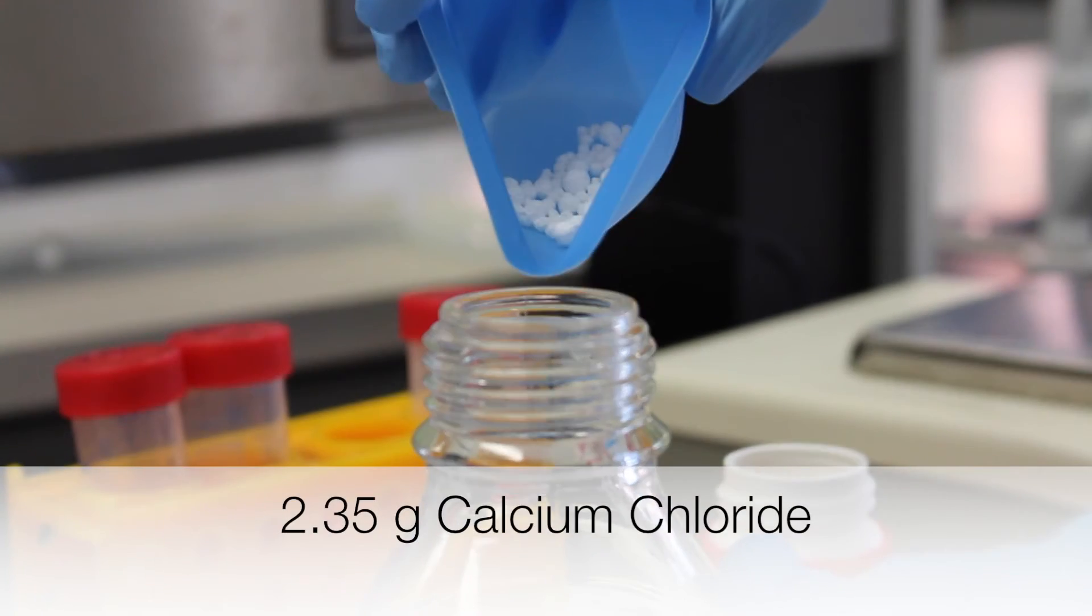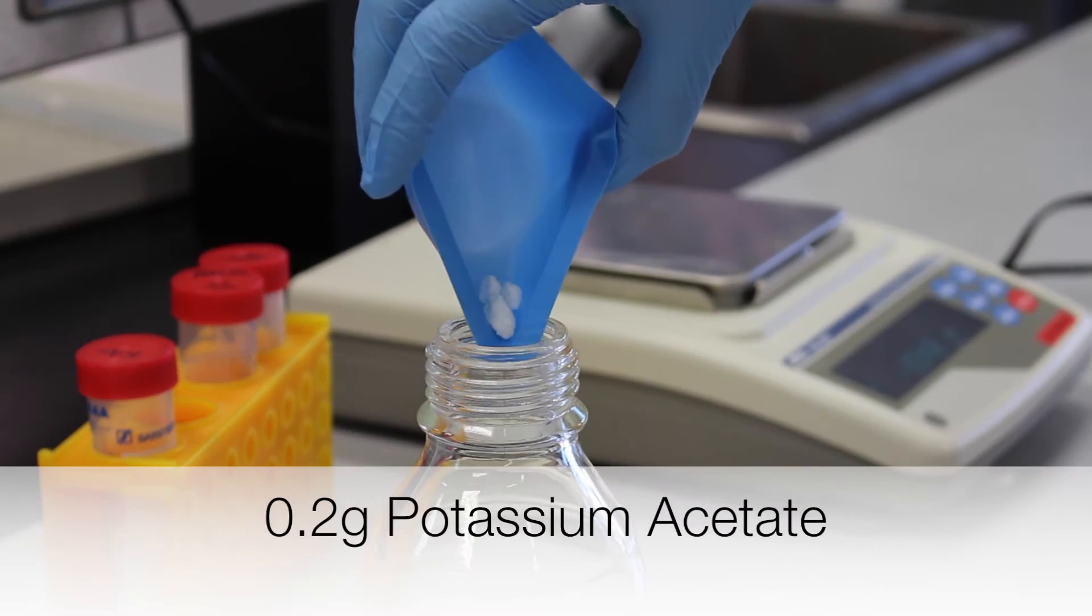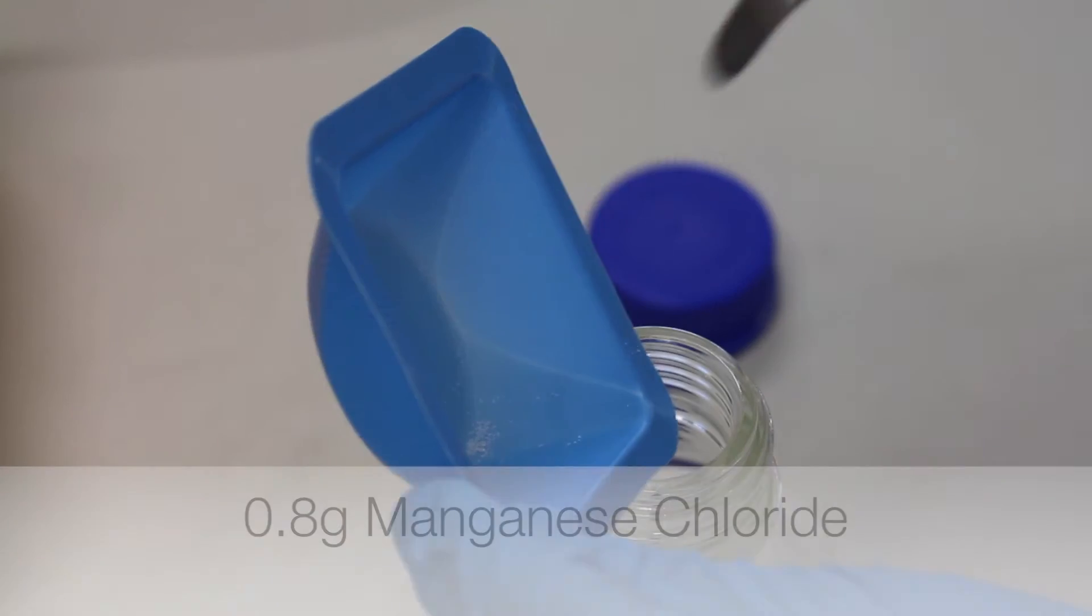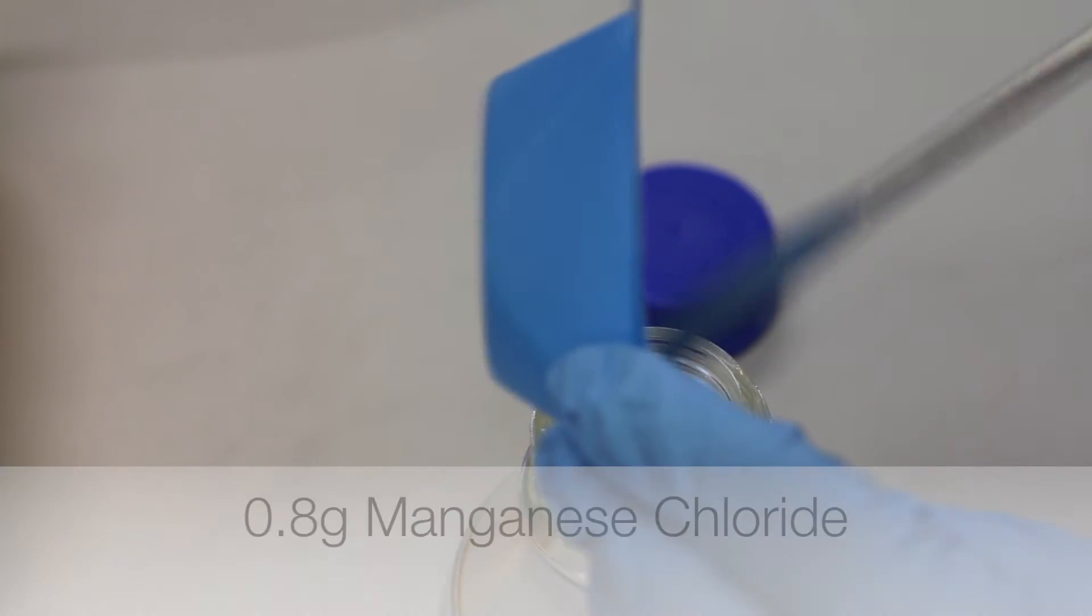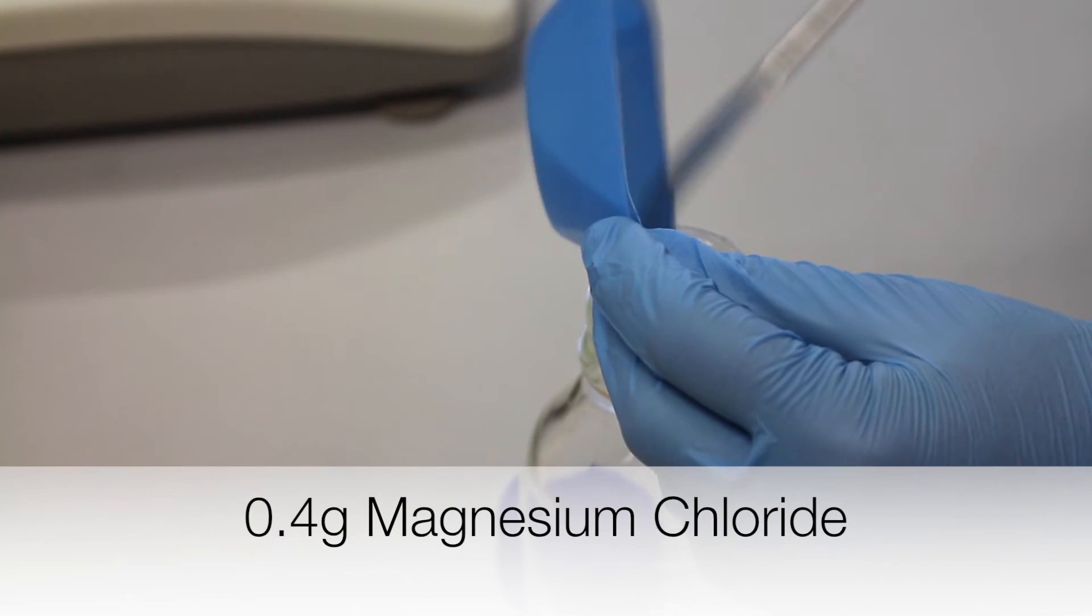2.35 grams of calcium chloride. 0.2 grams of potassium acetate. 0.8 grams manganese chloride. 0.4 grams magnesium chloride.